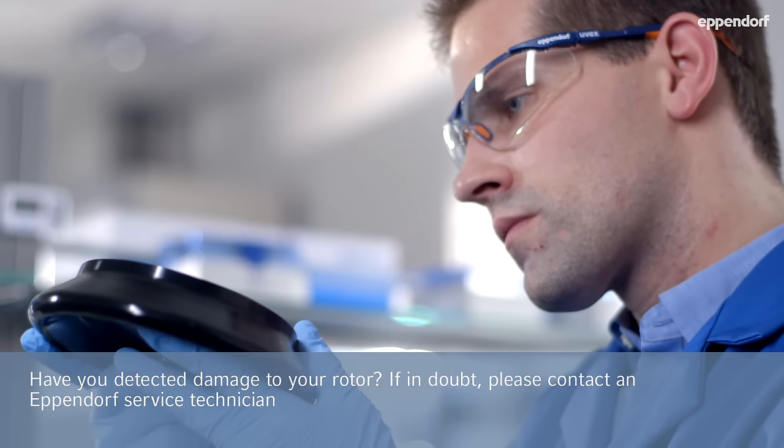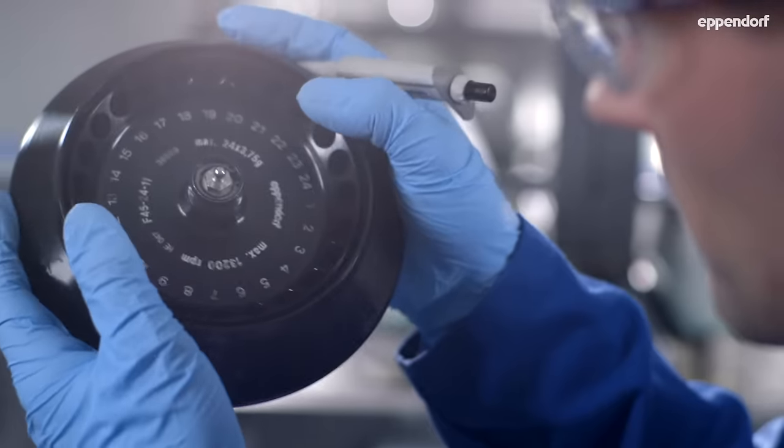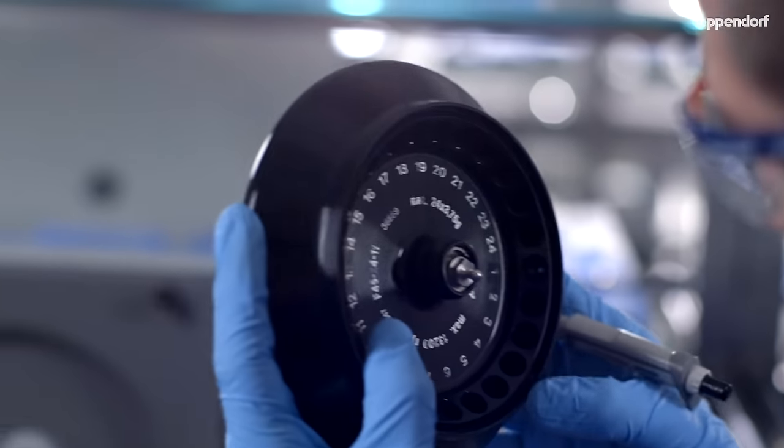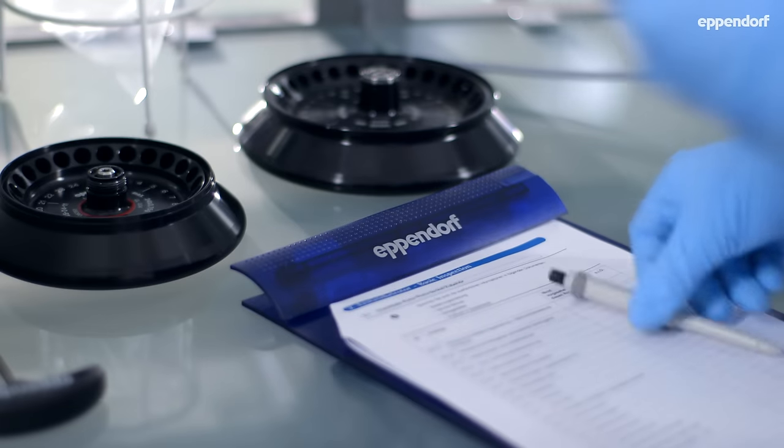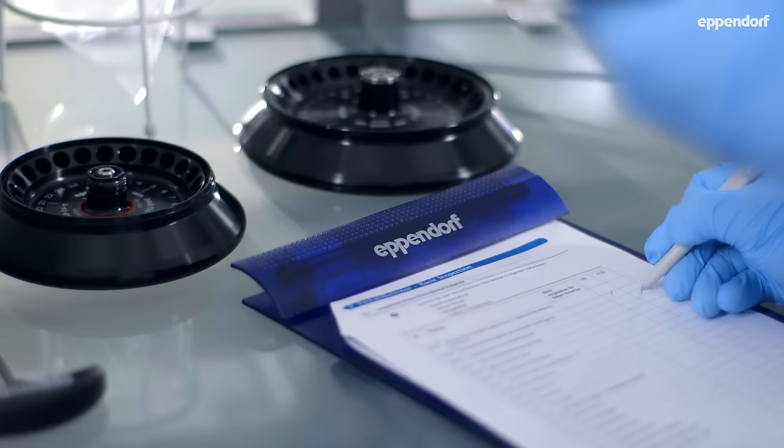Long-term exposure to aggressive chemicals can lead to corrosion on rotors and buckets, which may damage your rotor in a way that makes centrifugation unsafe.